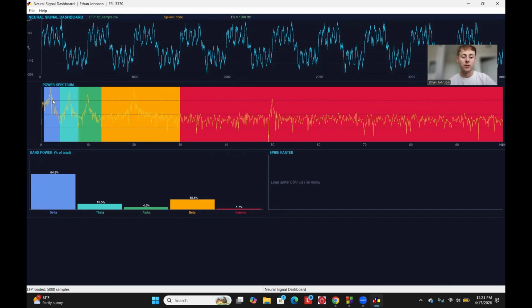And then we quantify the power in these different frequency bands, and that's shown here as a relative percentage to the other frequency bands. So we can see what is more prevalent in this signal. It looks like delta and beta. Then we can also look at our spike raster. But before we do that, we'll also notice down here, it'll show you a little status bar. So it shows that the LFP loaded and how many samples are in there.